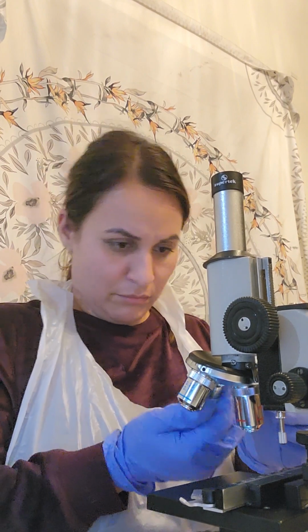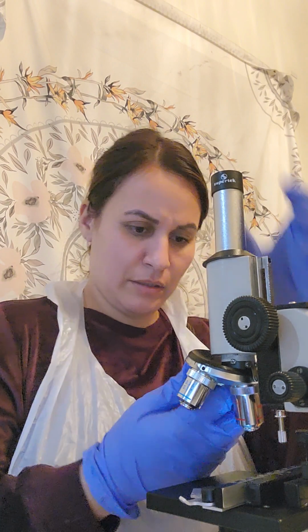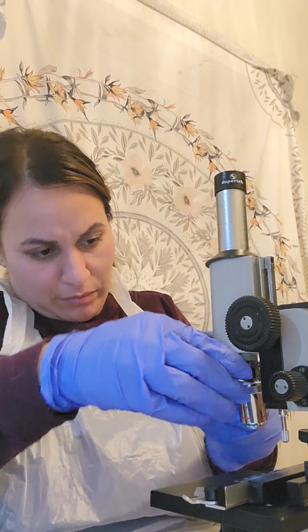Oh Lord. What am I doing here? I think I screwed it in too hard. It's not wanting to come out now.